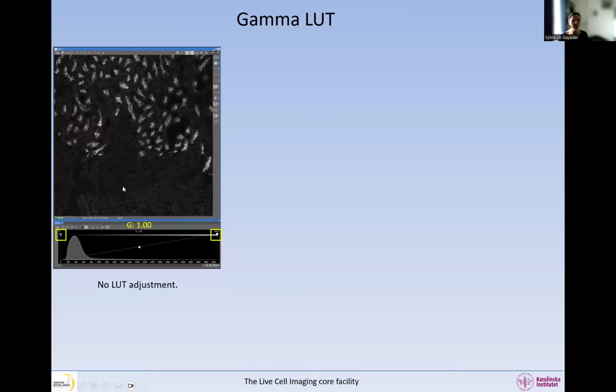So what you can do with the gamma: now we have this image, we have an area that is quite dim and an area that is brighter. And now we are showing the whole bit depth, we have no adjustments, and the gamma is 1. What we can see is the bright areas in the image quite okay, but the dim areas are almost, it's very difficult to see any details in them. And we would like to display both the dim areas and the bright areas so that people can see details.